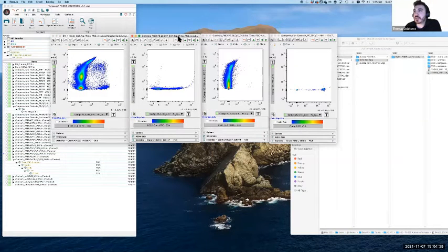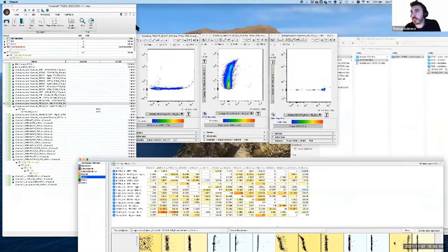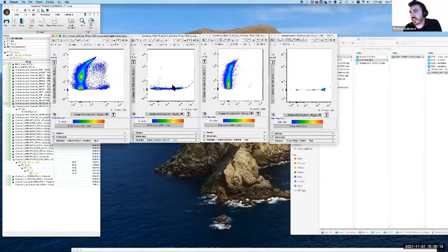So we have the same sort of deal. Here is our FMO for PE-Cy7, where there should be no PE-Cy7 signal whatsoever. And here is our FMO for PE-Cy5, and there should be no PE-Cy5 in this sample. And then here's our single stain as well. Now, in this case, I forgot to set this up correctly earlier, but there is another example of this in case 2, which we'll come to. When I changed this, I didn't change it quite enough. We'll come to some of this in case 2.